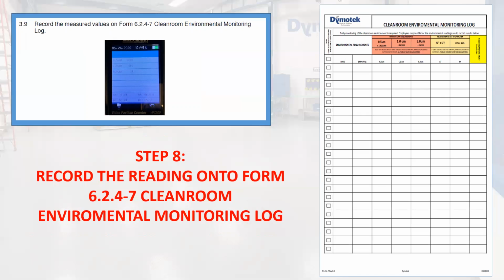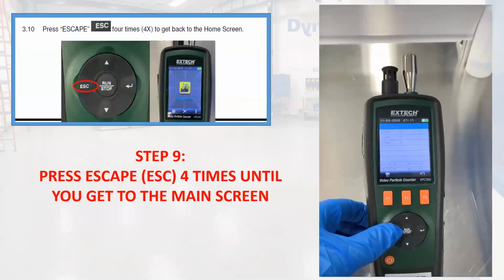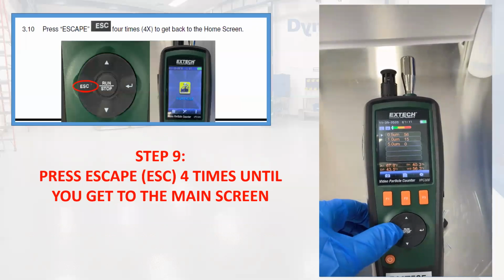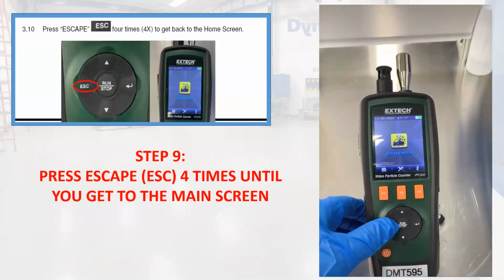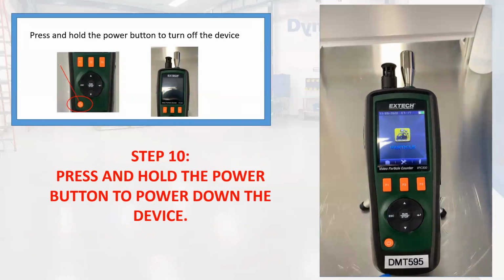Record the reading onto the form 6.2.4-7, the clean room environmental monitoring log. Press escape 4 times until you get to the main screen. Press and hold the power button to turn off the device.